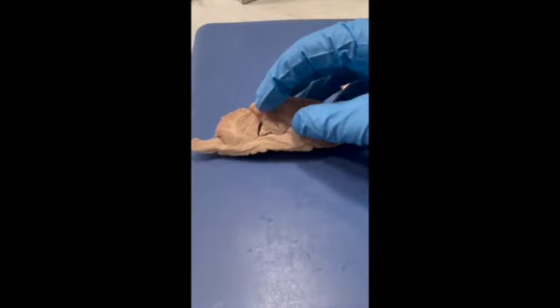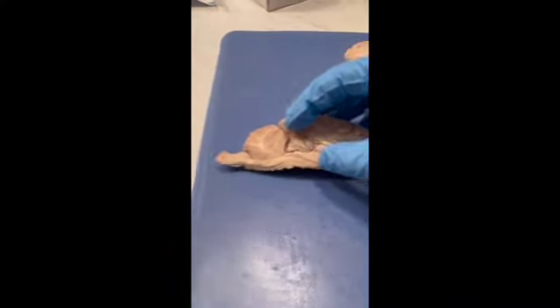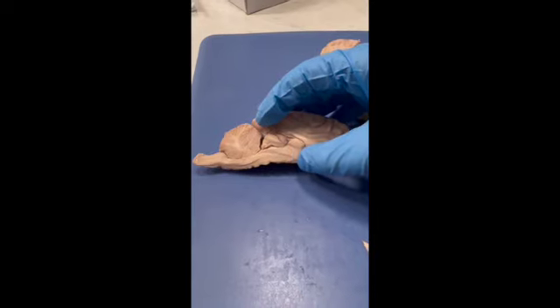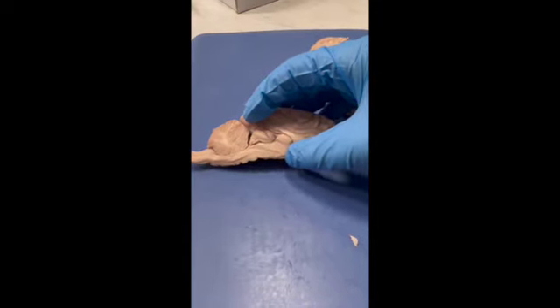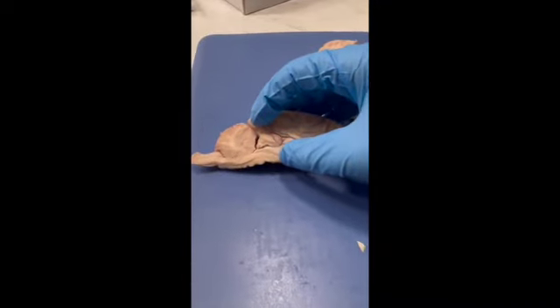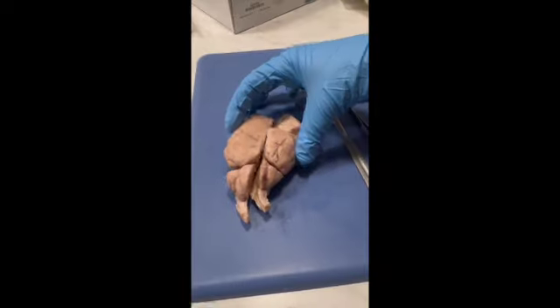Just looking here, in the middle is the midbrain between the thalamus and the pons, and that region is full of important nerve tracts. And then the dorsal areas are responsible for visual and auditory stimulus, the main part of it.